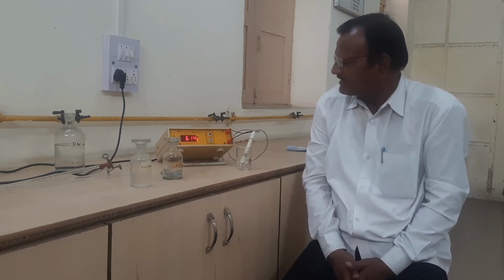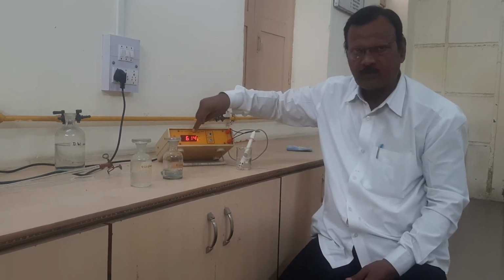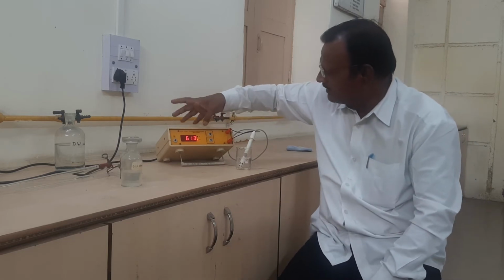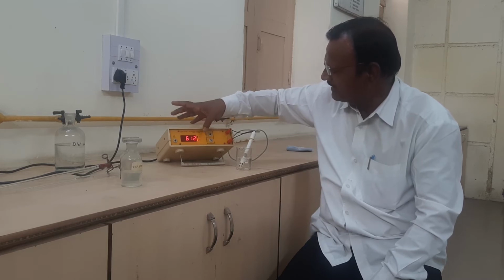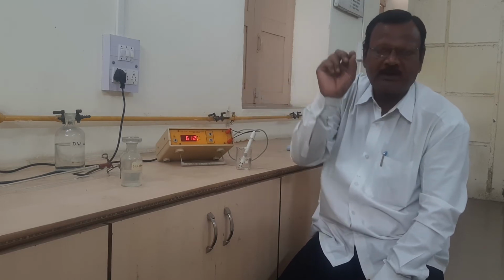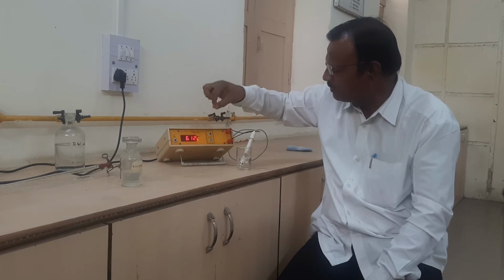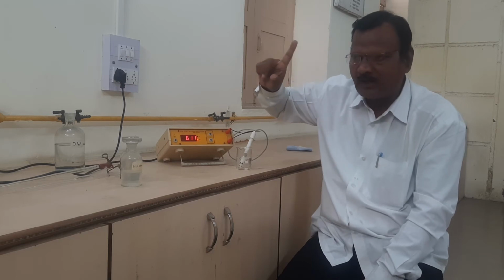The reading may appear here, 6.14. But here, those readings may be like 6.13. Here mS: m indicates milli, and S indicates Siemens. About this m, the value is 10 raised to minus 3, and every time we have to read those readings, 6.12 into 10 raised to minus 3 Siemens. This is without addition of strong alkali.